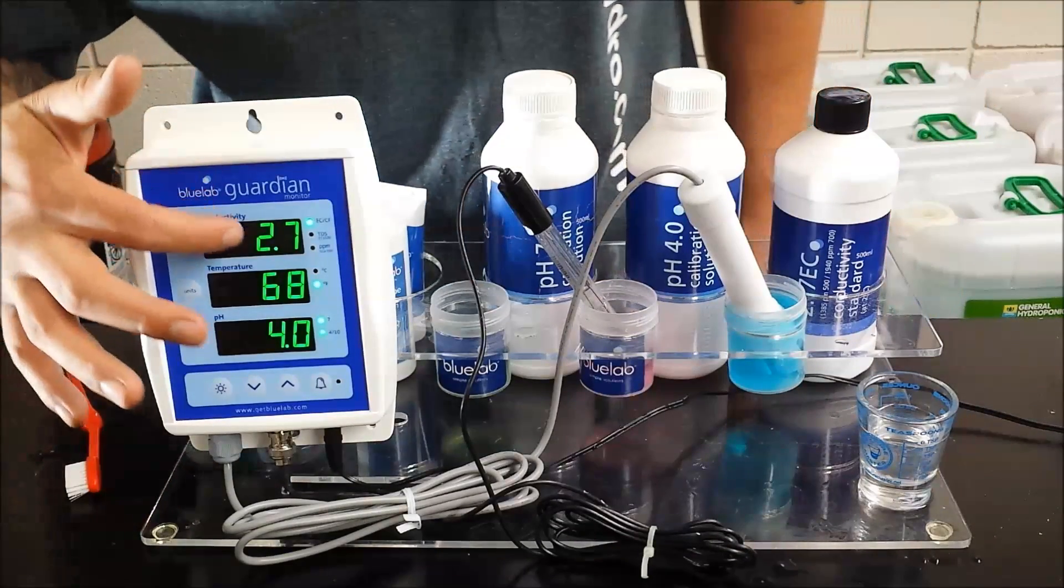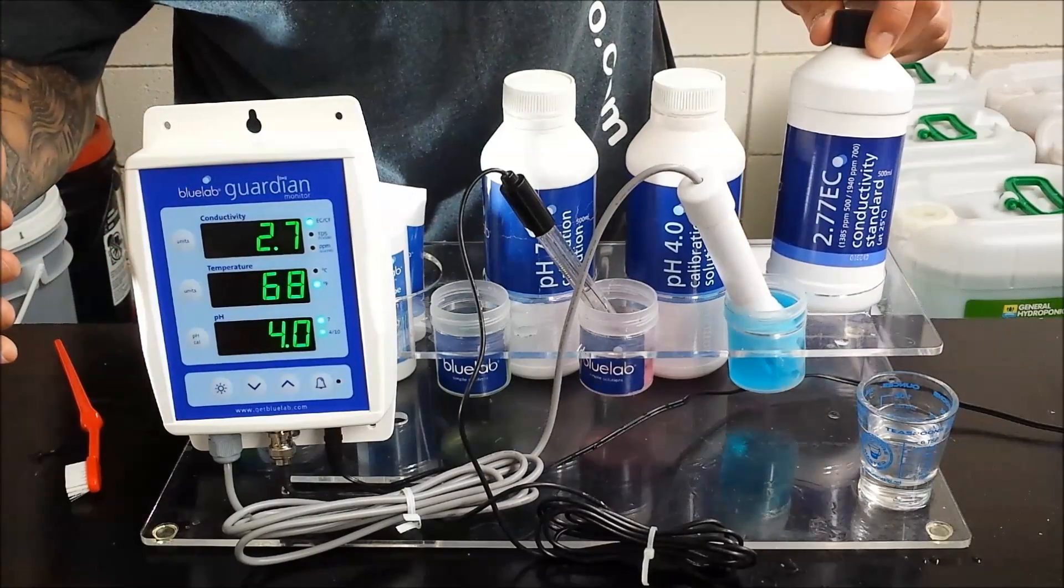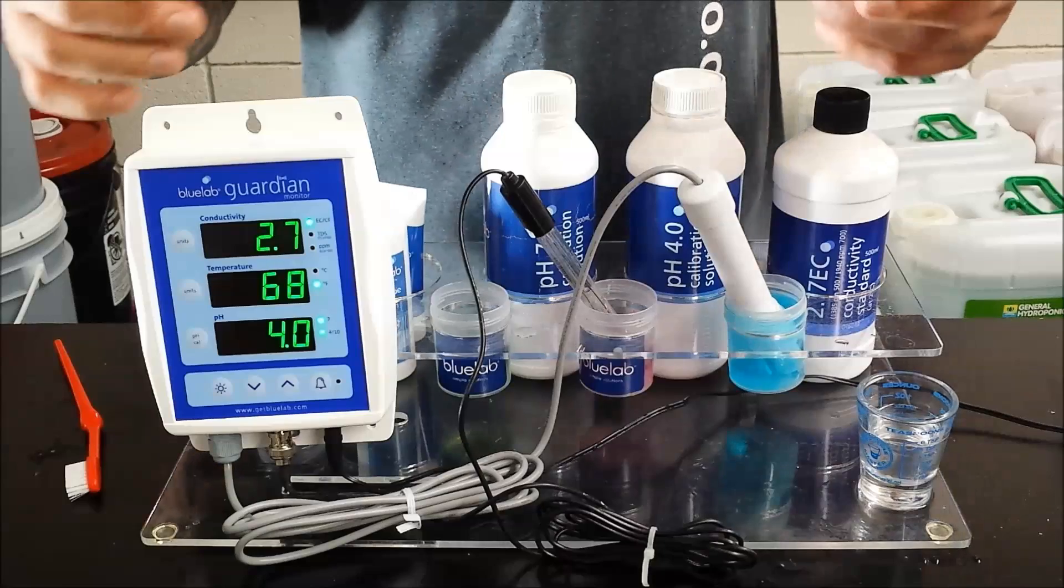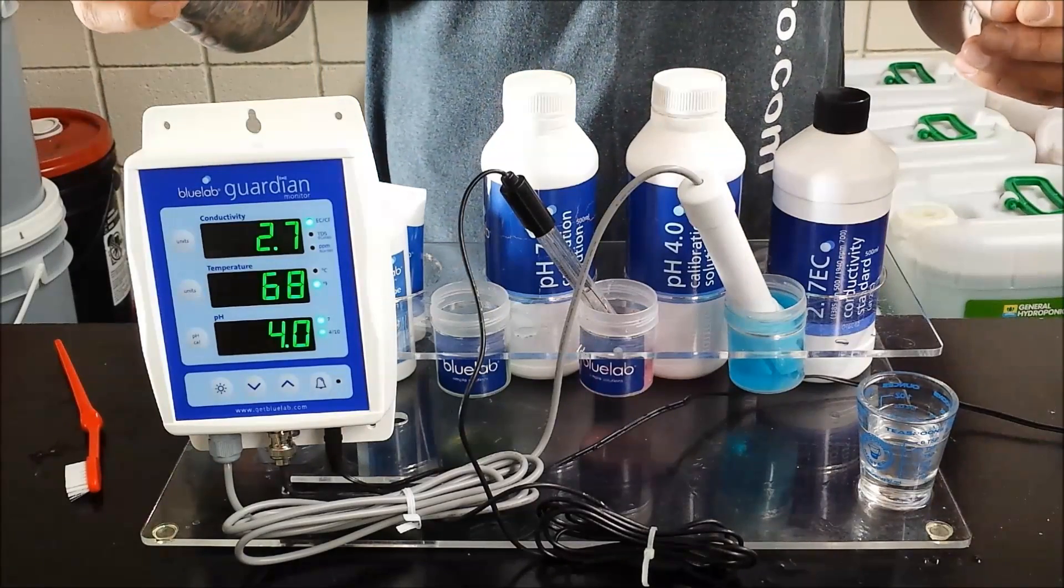And you can see for reference 2.7 on your nutrient meter is correct with the 2.77 nutrient solution. As always if you have any questions or problems feel free to come in or call us.